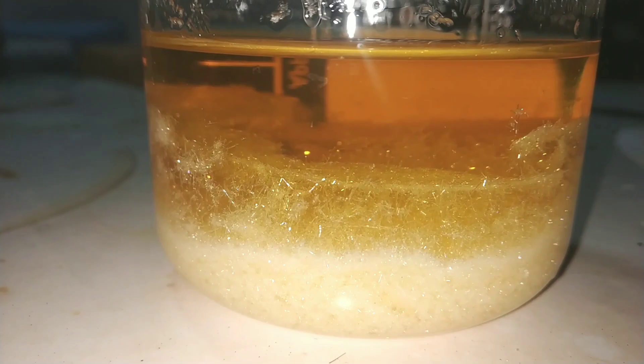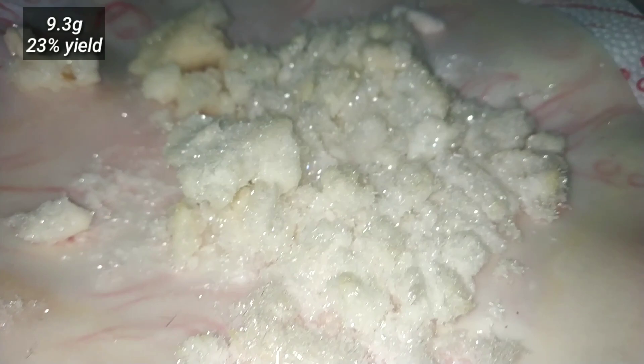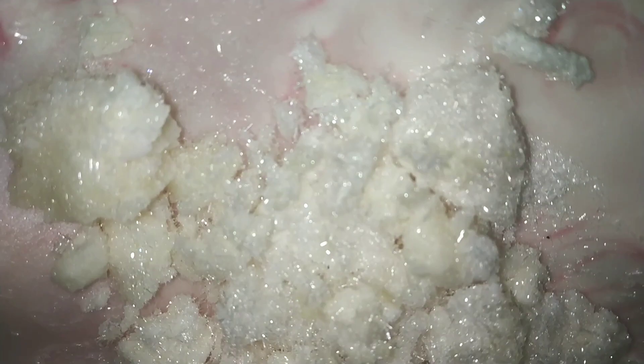The solution was then cooled and much purer crystals of benzoin separated out. It was then filtered a second time, washed with a mixture of ethanol and water, and dried. I obtained a total of around 9.3 grams, which represents roughly 23% yield — which is not bad considering the fact that we are not using the cyanide salt.